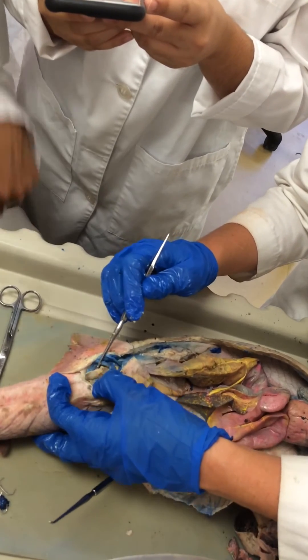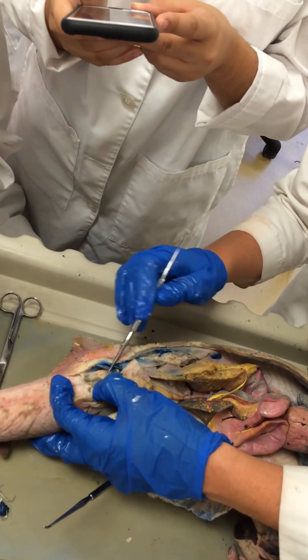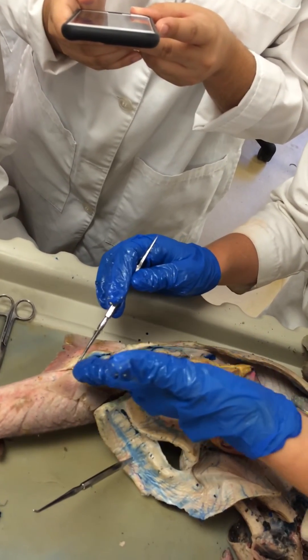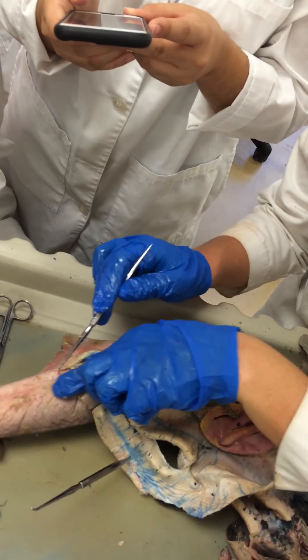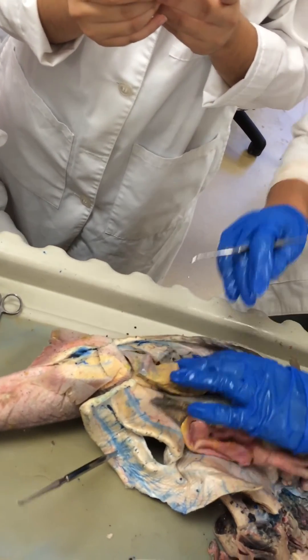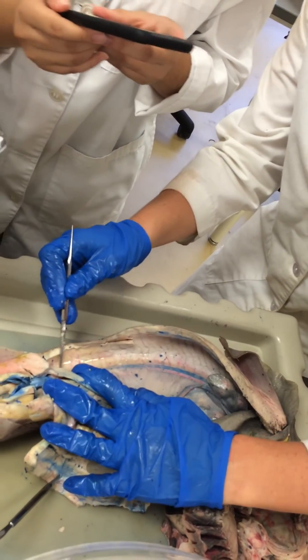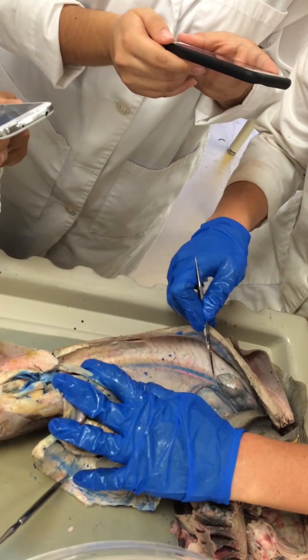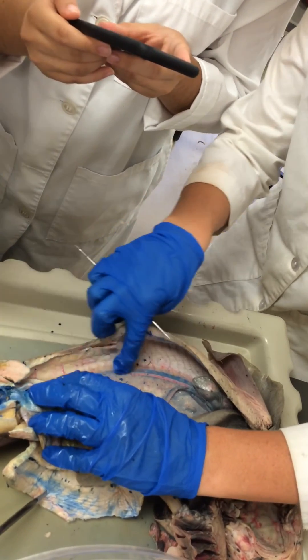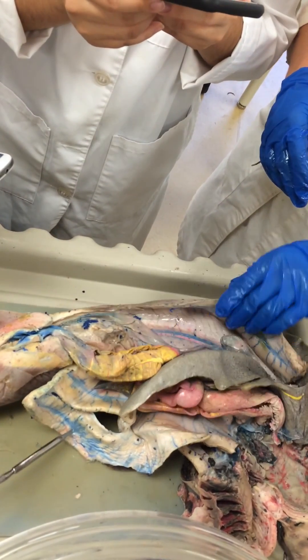This one has an extra large papillae. In females, this is the urinary papillae because it only excretes urine. In males, this would be called a urogenital papillae because it would secrete urine but also sperm onto a groove where the clasper would be. One other thing I wanted to mention were the kidneys. The kidneys are these structures running along the backbone — there's one on each side, kind of yellowish, and they go all the way down. We'll go over that more in the urogenital section.